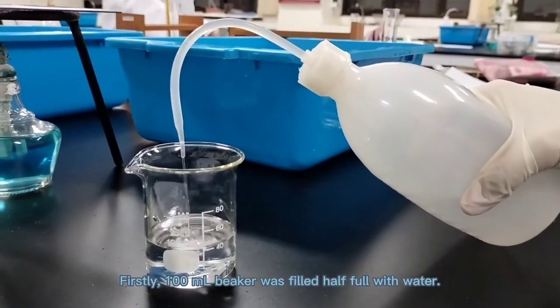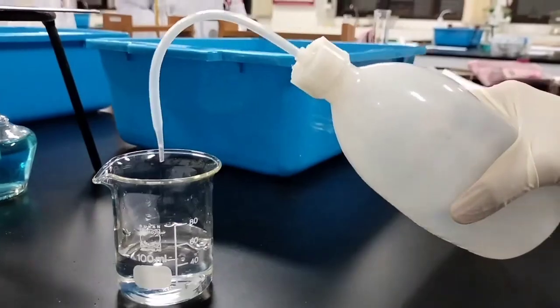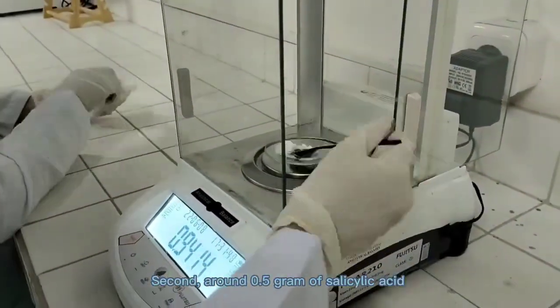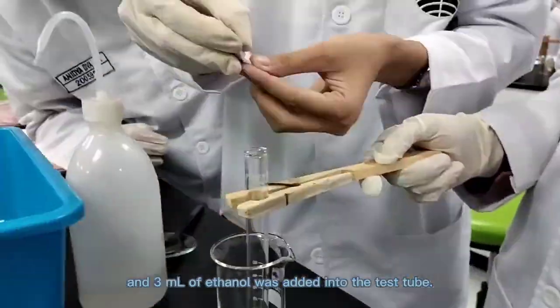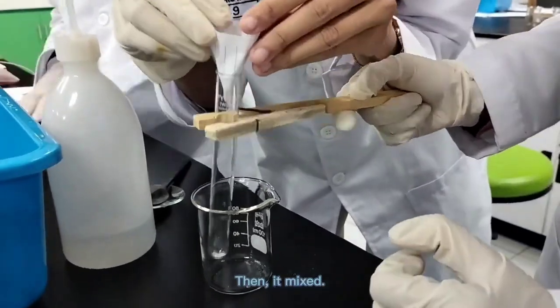Firstly, a 100 ml beaker was filled half full with water. Second, around 0.5 gram of salicylic acid and 3 ml of ethanol was added into the test tube, then it mixed.